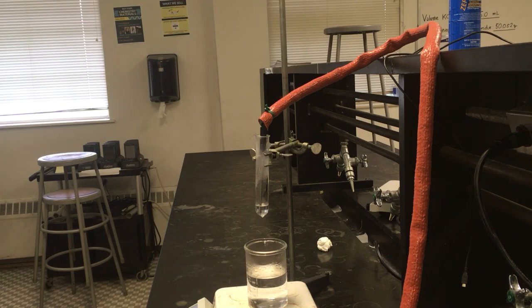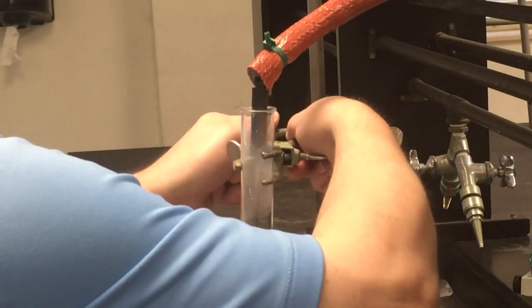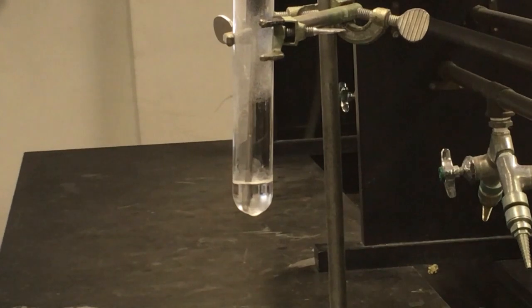I'm going to zoom in so we can get a better view of things here. Maybe even raise this up just a touch higher so you can see it. Apologize for not being a camera expert here, but hopefully this will be a good enough view of things to see what's happening and when. And I'll make note of the temperature of when we actually start to see some crystals form in our solution.